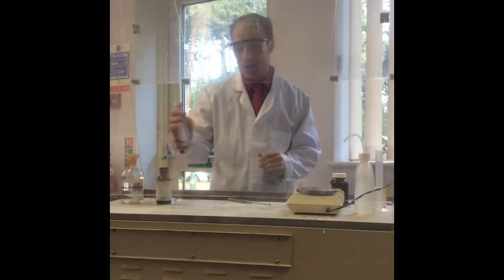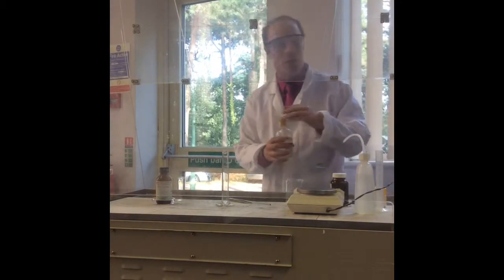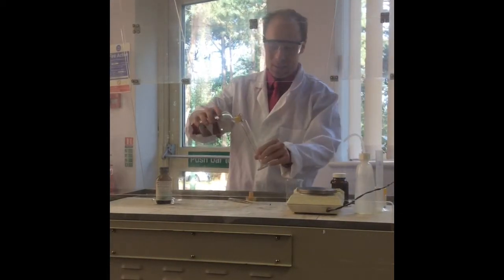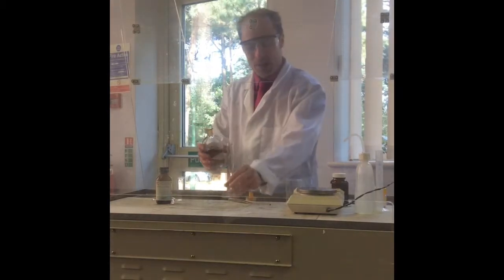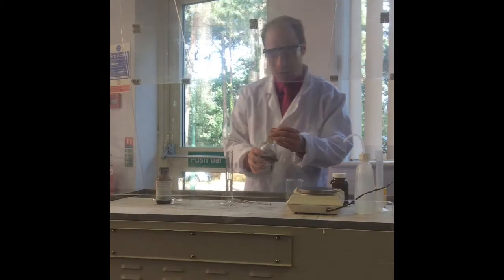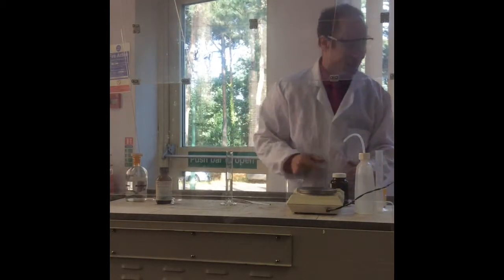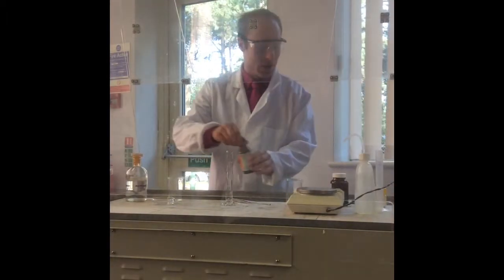Okay, so we need, first of all, to get an organic solvent. This is petroleum ether, and this we're going to use to dissolve the dichloride. So it would be the acid that's got the chlorines come out. So I'm going to take 15 centimetres cubed of this, and into it I'm going to add about 0.5 centimetres cubed of this stuff here. But this is the nasty stuff.